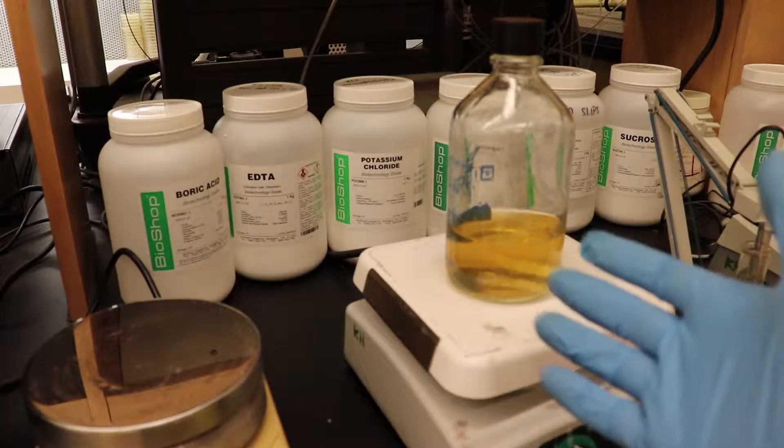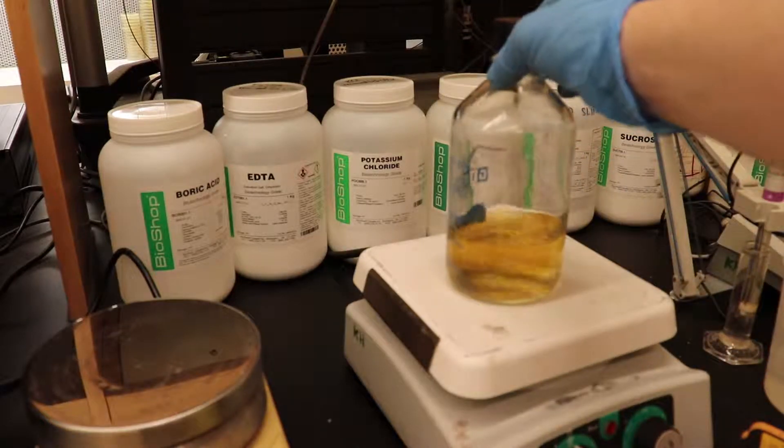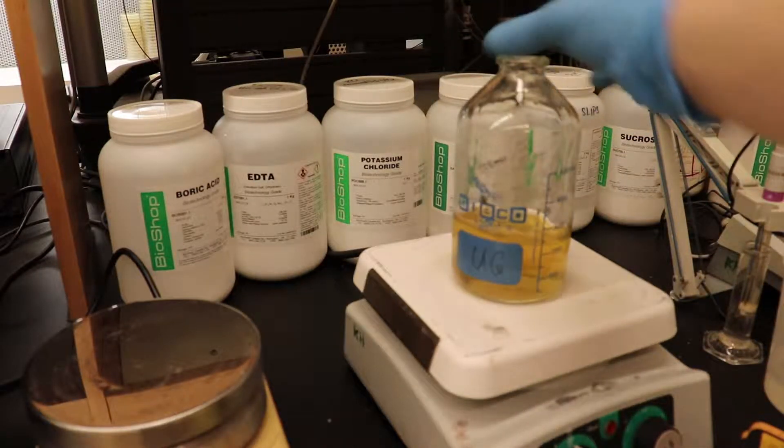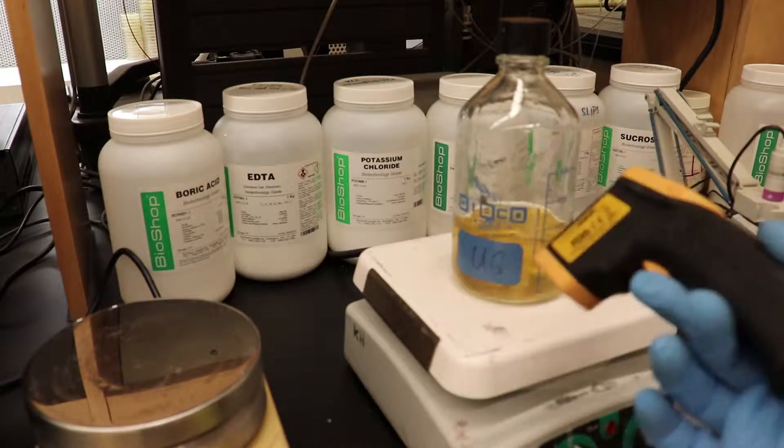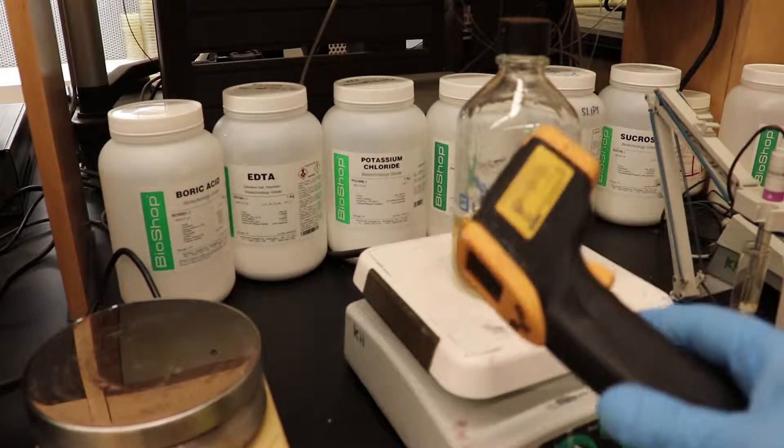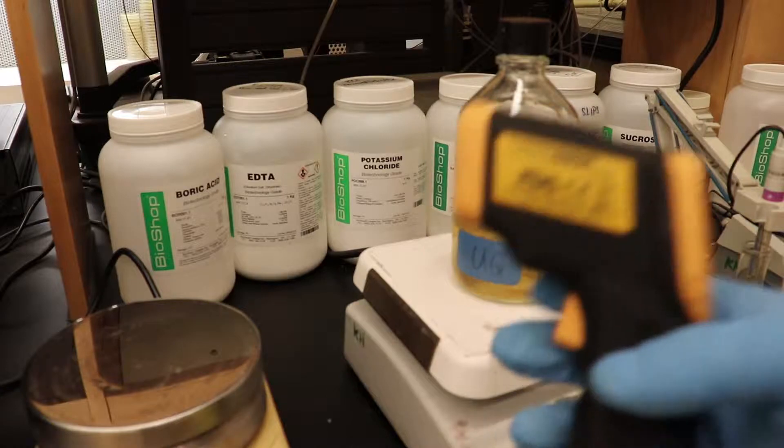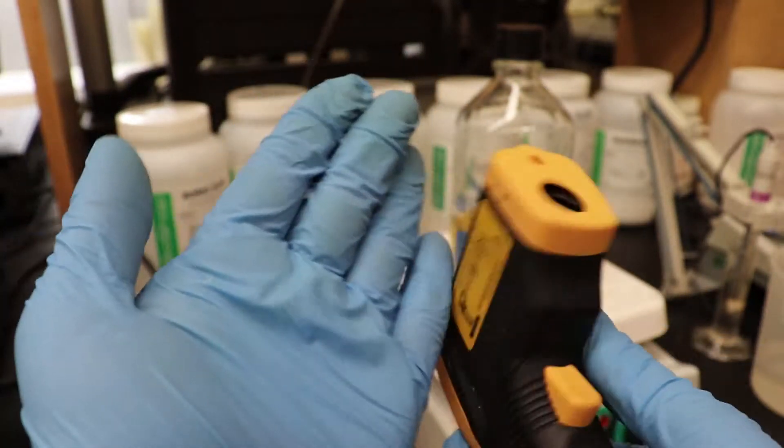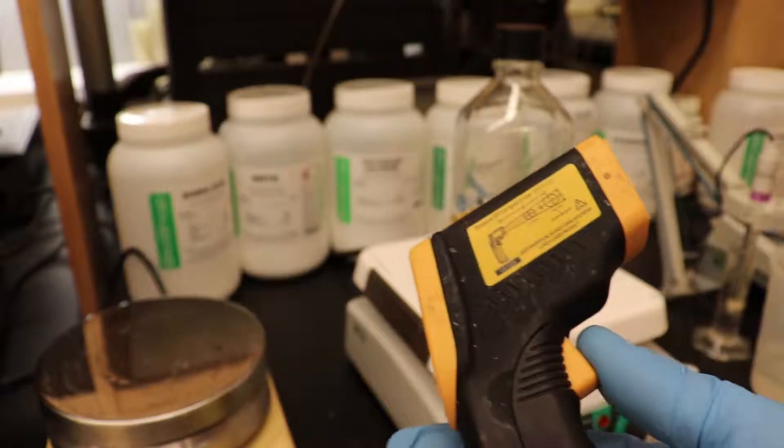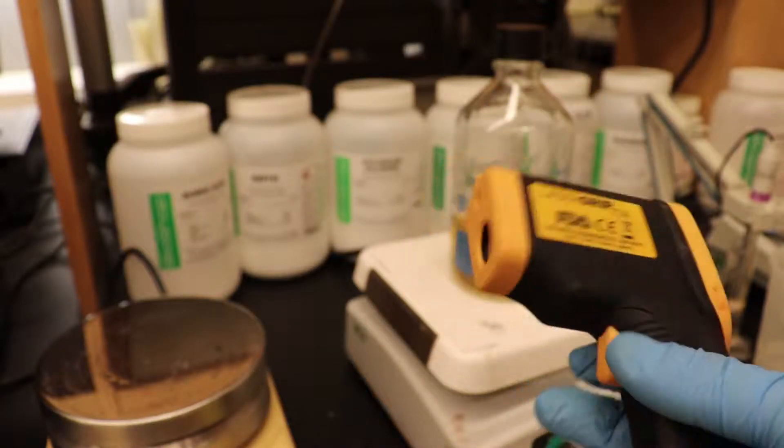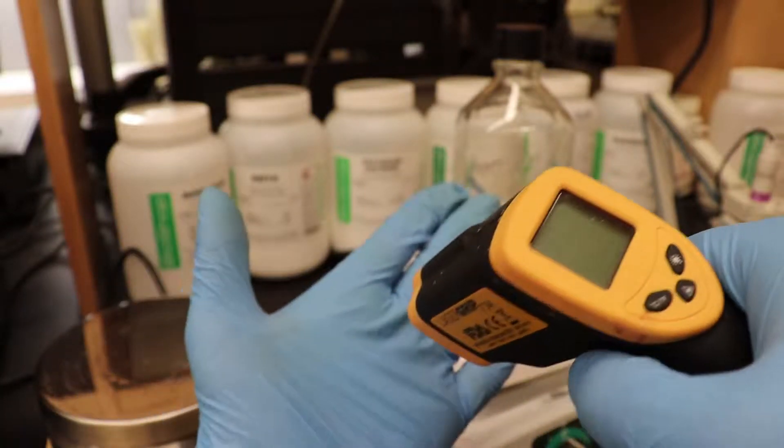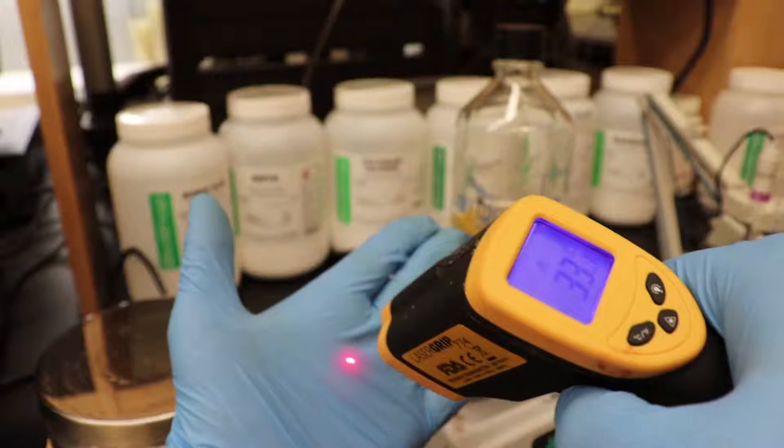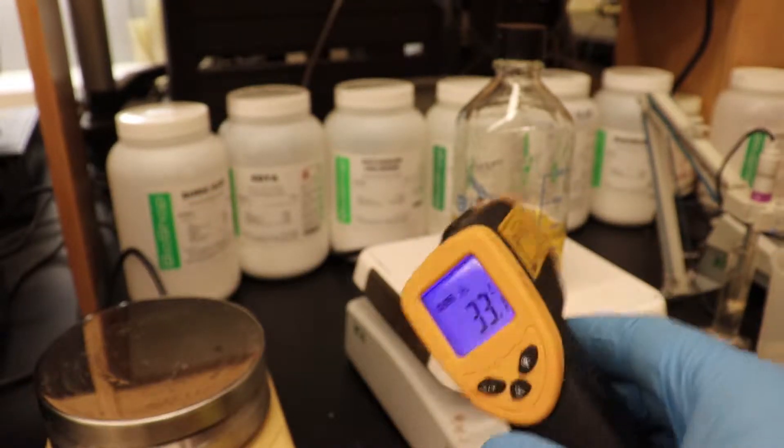Depending on the type of antibiotics, you want to make sure that you let it cool down a bit before you add your antibiotics. And one thing that's extremely handy for that, and actually even when you're doing plates properly, this is extremely handy, are these infrared thermometers. And what's nice about them is that you don't actually need to stick your probe or your thermometer in anything to get the temperature. So, you know, I can get the temperature of my hand, and I can get the temperature of the media.